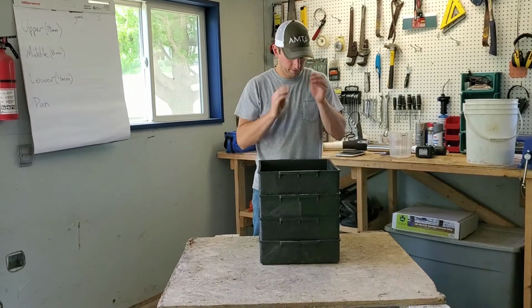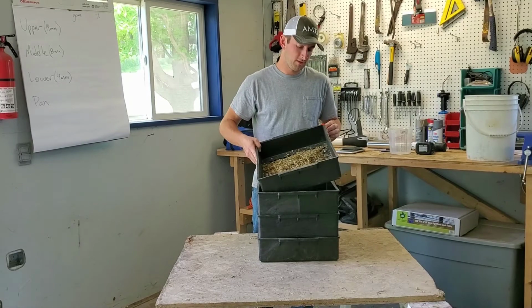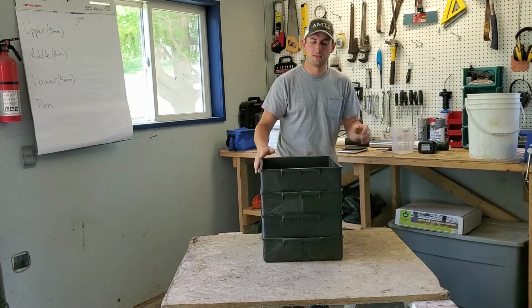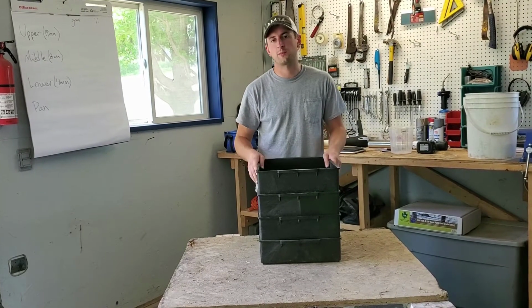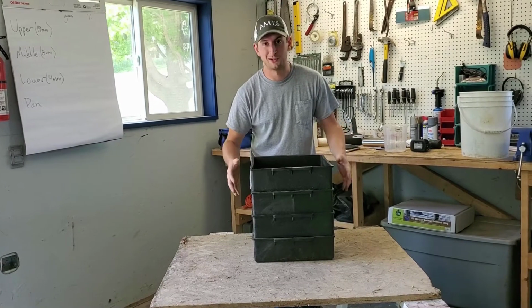You can see on my box here I have a little mark so I know which corner is my starting corner, so that I don't lose track as I go. What we're looking to do is have about a 7-inch stroke here, and around 1 shake per second, or 1.1 hertz is actually the official recommendation. So we're going to try to achieve that.